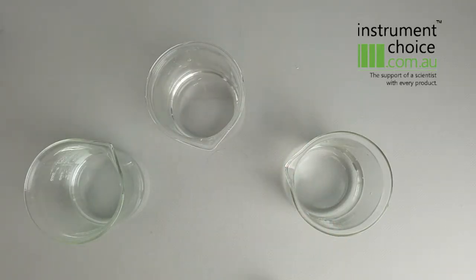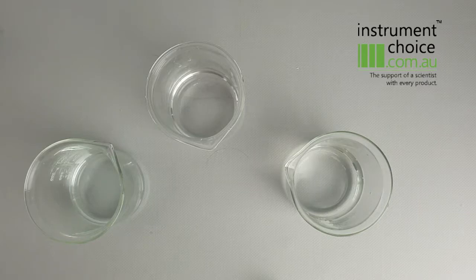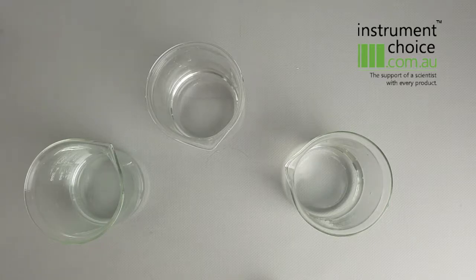Give it another good shake off, and then what you want to do is calibrate it to a known standard so when you're doing your measurements you know exactly that it is accurate.